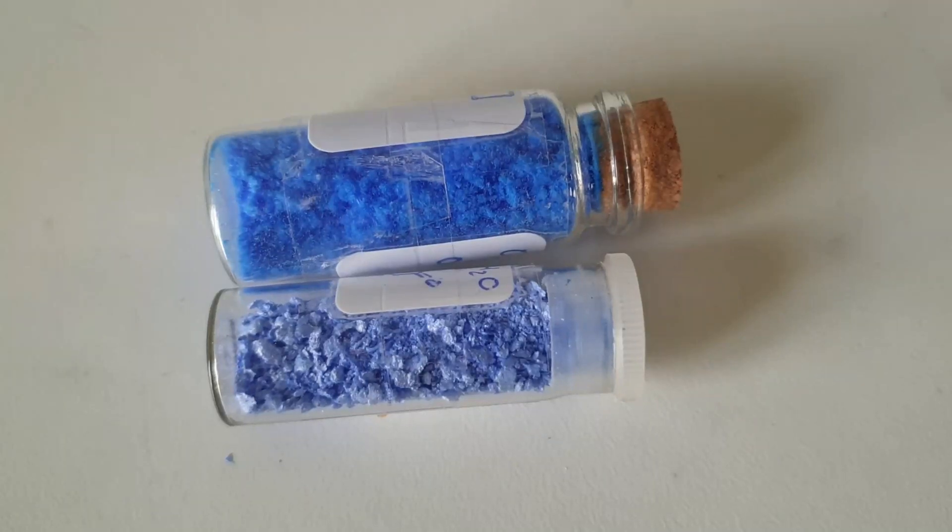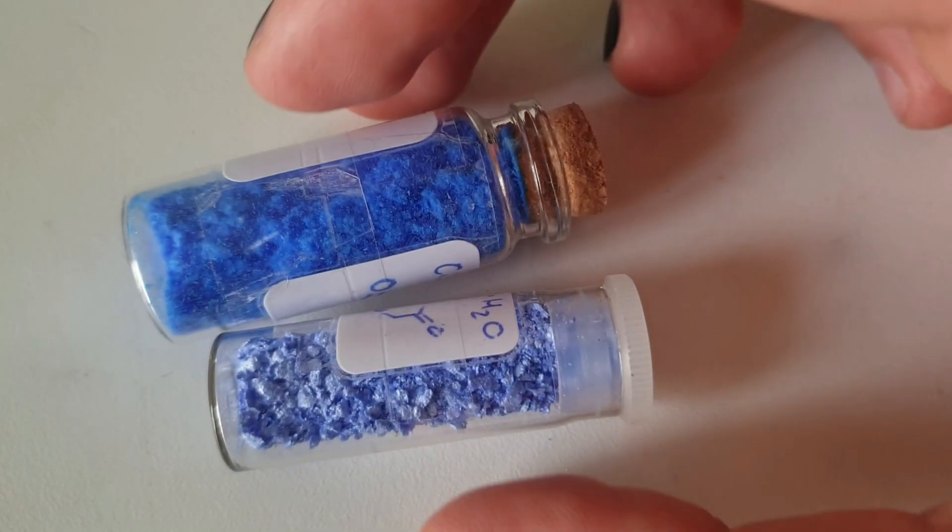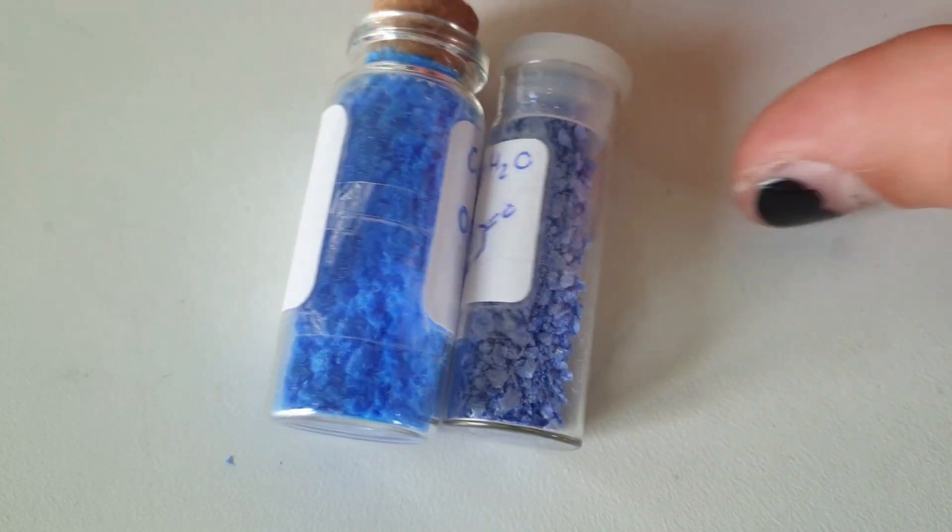Here are the two complexes besides each other for comparison. Both of these are the monohydrates.